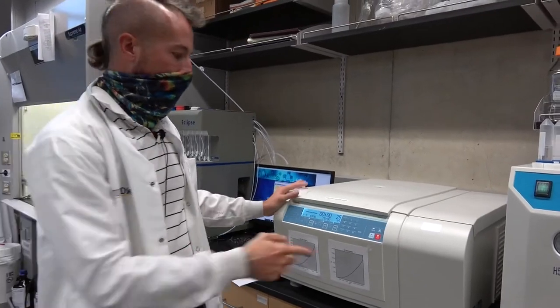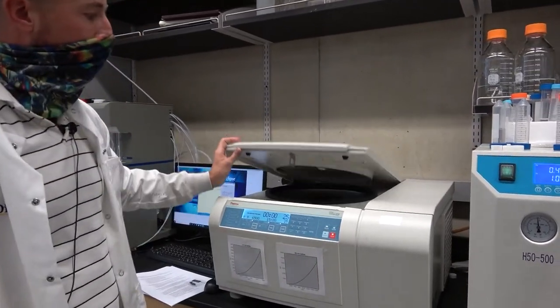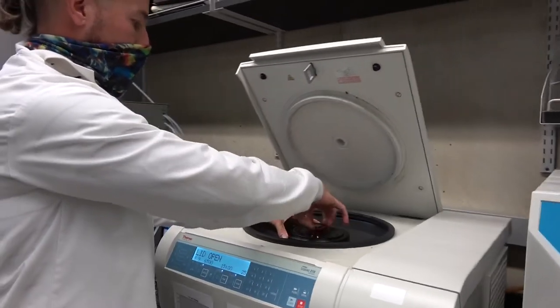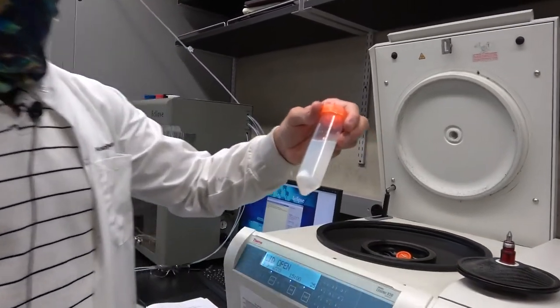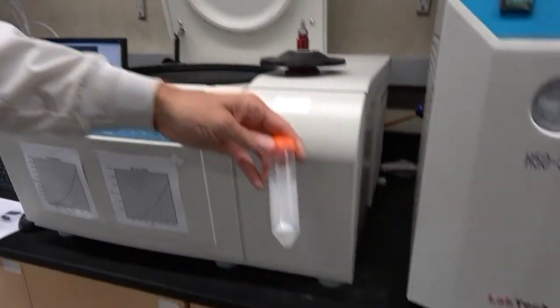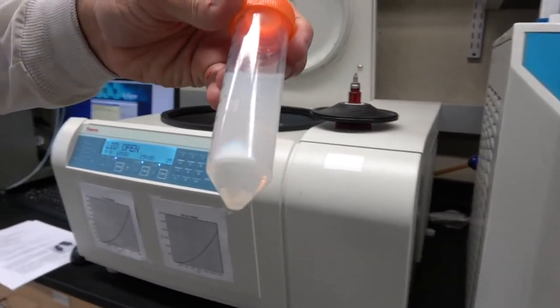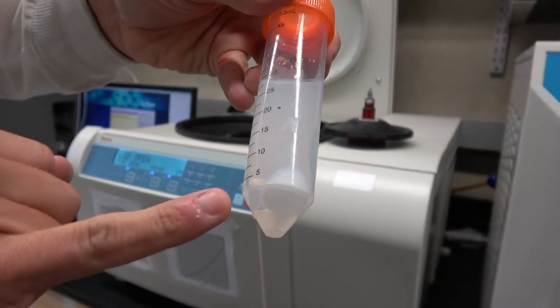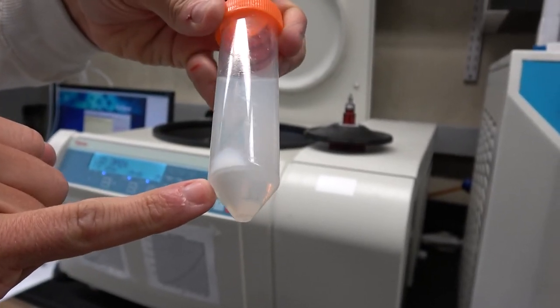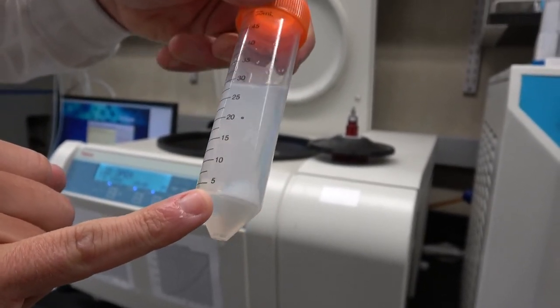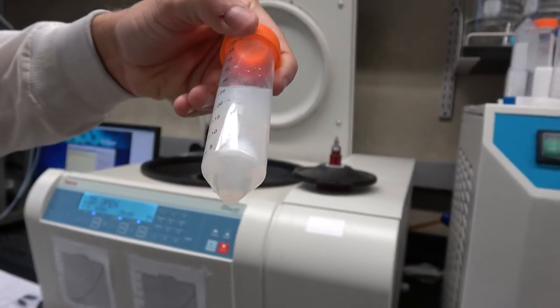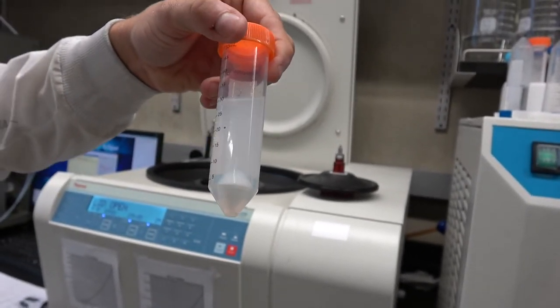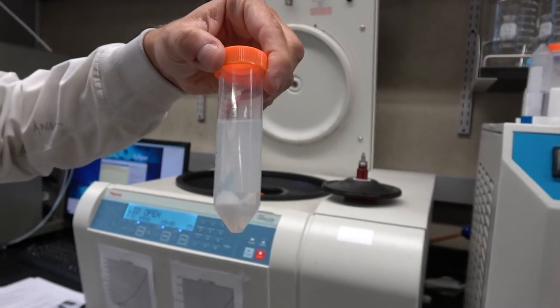If I hit this, it's right now on RPM, revolutions per minute. I want to hit it again and turn it into units of G, relative centrifugal force. Speed I want 6500, so 6500 times gravitational force. Time I want 15 minutes. Enter. These are just some other parameters: how fast it accelerates and decelerates. I want it to do both of those things very fast. Let's start. Up we go and we're gonna record this for 15 minutes and make you listen to it. No, I'm kidding. End of run, so we can go ahead and open it up. What you can hopefully appreciate is this pellet of particles right there.